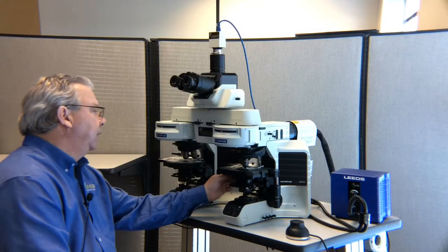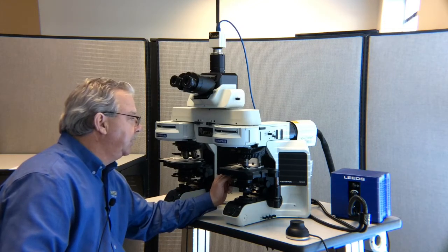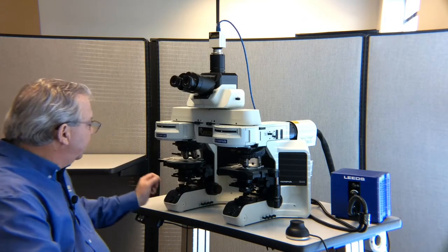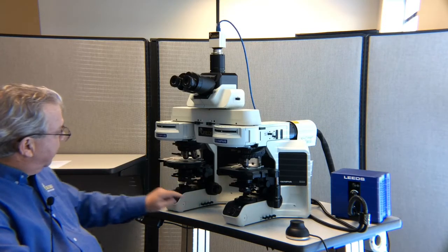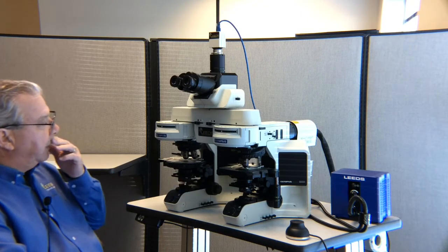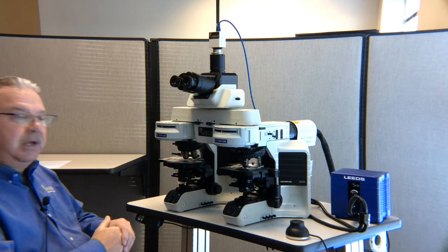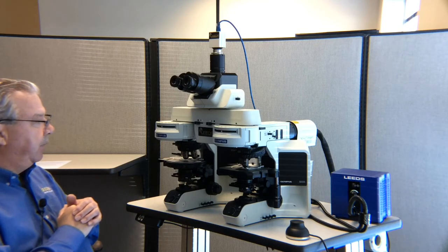Moving up from there, this particular condenser has a flip-out top element. Most of the LCTs we've built have this, but certainly some of them have a fixed top lens. In this case, we're going to flip that lens up on both sides of the microscope, and we're also going to make sure that our aperture diaphragm is all the way open. Once we achieve color balance and you're looking at your samples, if we need to close that aperture diaphragm back down, you're going to be able to do that. You're just going to want to close both the right and the left aperture about the same amount.